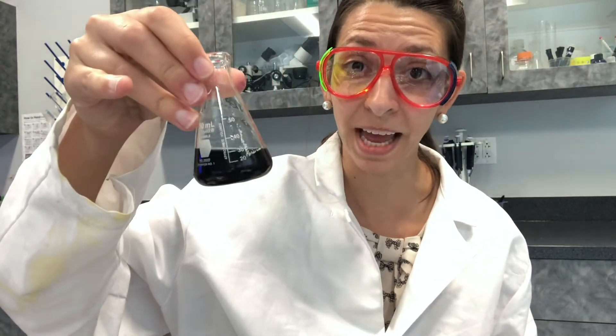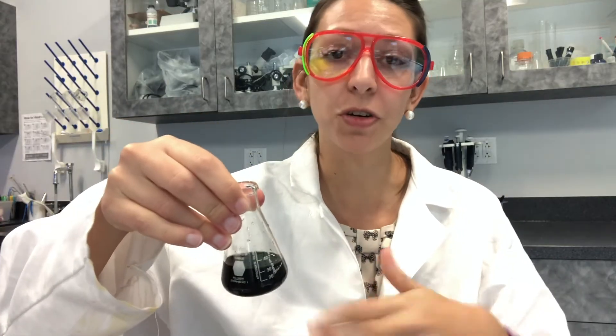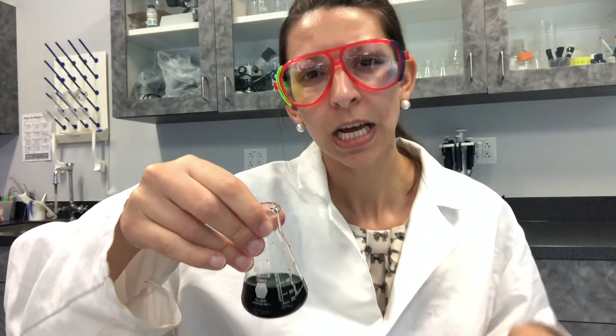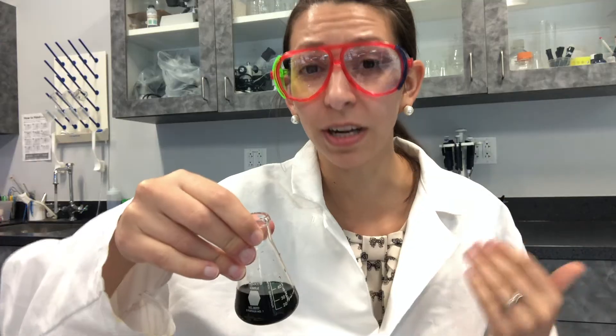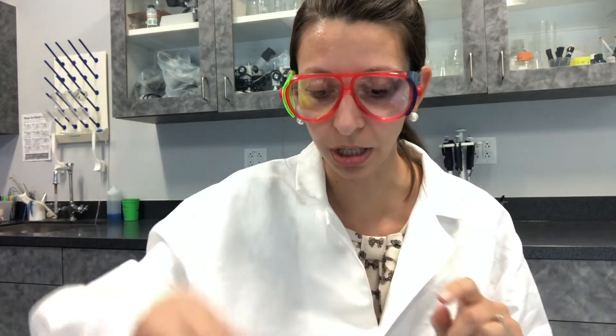Now we're going to run this experiment again, but this time we're going to be doing a high level activity. My high level activity is going to be running in place for one minute. Before you exercise, make sure your bromothymol blue is set up again back to the same color as before. If you don't have the materials to set up a new solution, you can use the previously used solution, but your data may vary because you've already added sodium hydroxide to it. I've set up a new solution here.